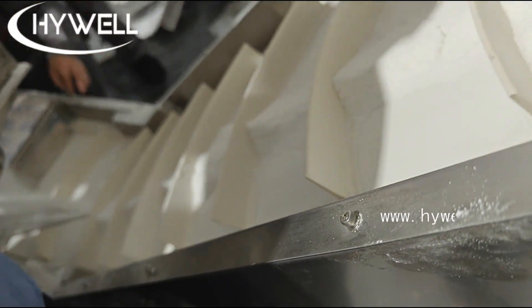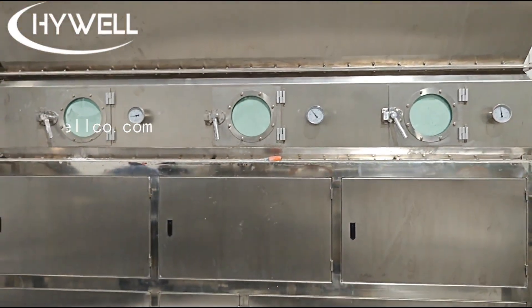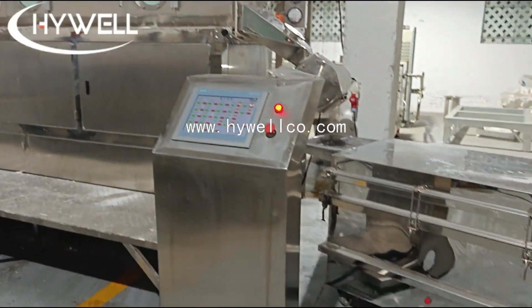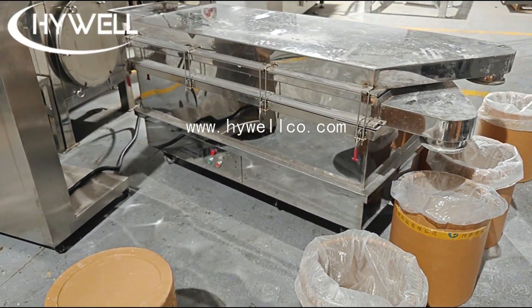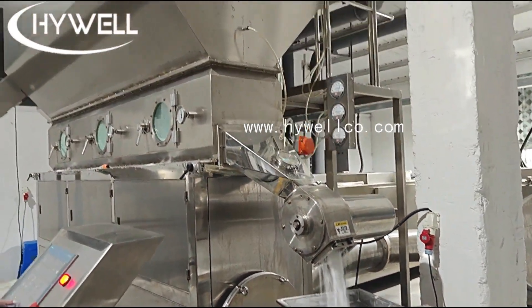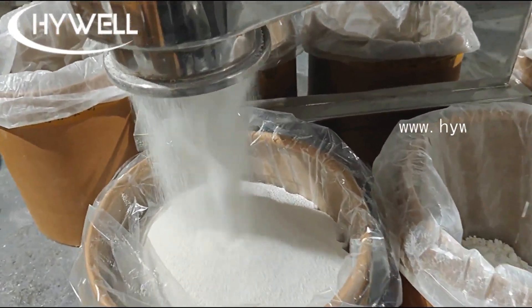Process advantages of the wet granulation process line: One, high degree of automation — the entire production line has achieved automated operation from feeding to packaging, which greatly reduces labor costs and improves production efficiency. Two, strong production continuity — the connection between each device is close, which realizes the continuous production of materials and ensures the stability of output. Three, product quality assurance — through strict process control and equipment performance, the quality of the final product is stable, the particles are uniform, and the instant effect is good. Four, energy saving and environmental protection — the use of advanced process technology and equipment design reduces energy consumption and material waste while ensuring production efficiency, which meets the requirements of modern green production.